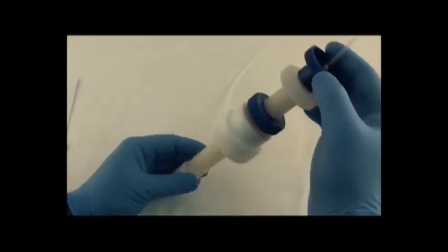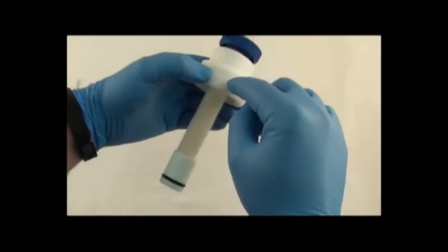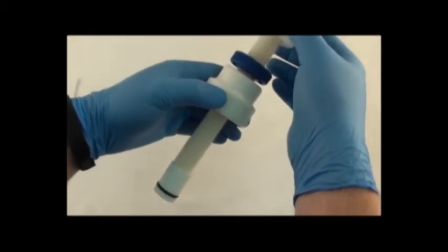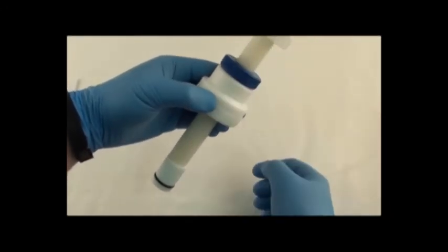And when you're using this, screw the end cap onto the column. And then you adjust the bed height. And then you lock the ring.